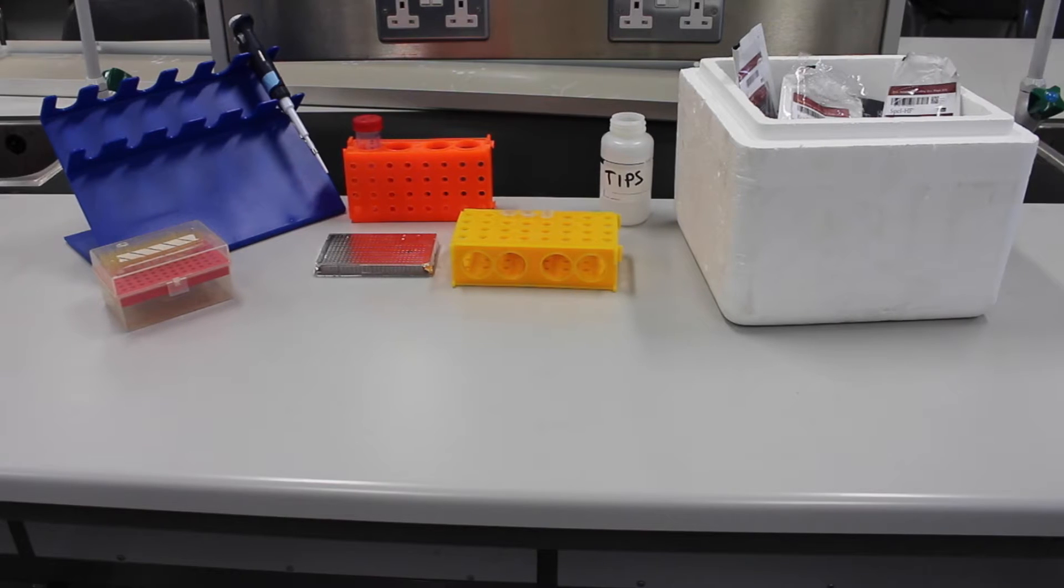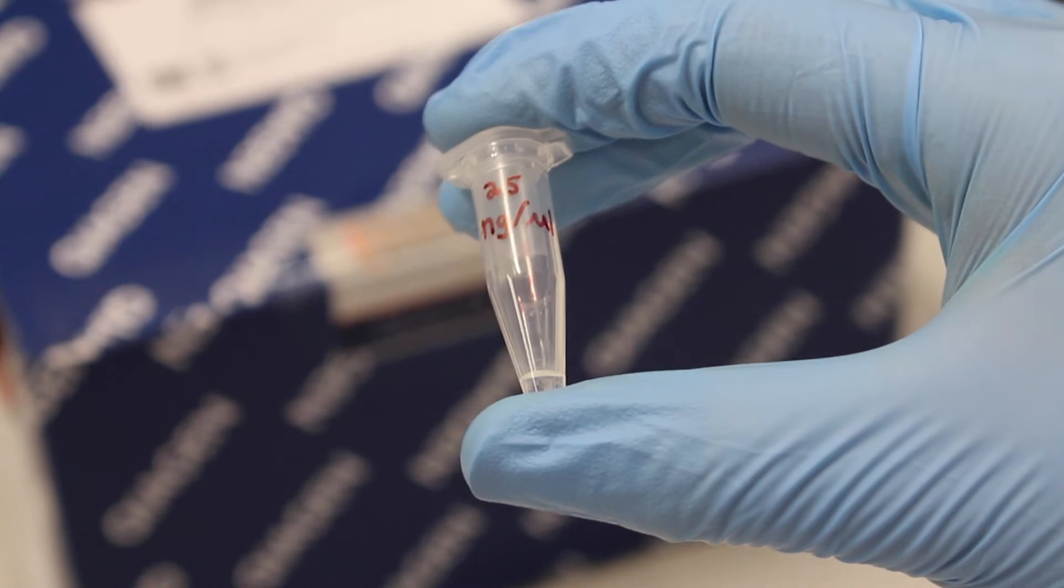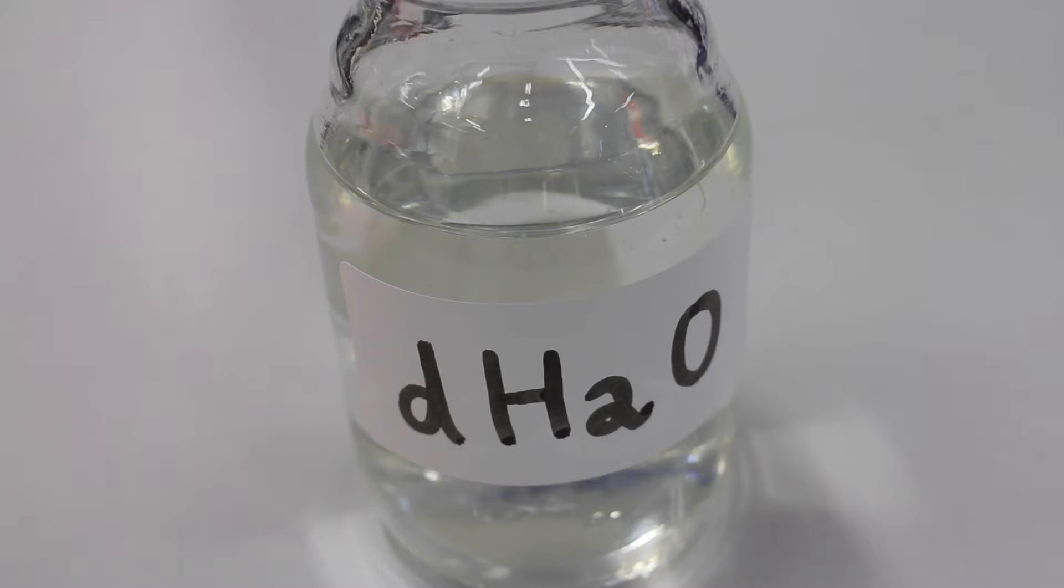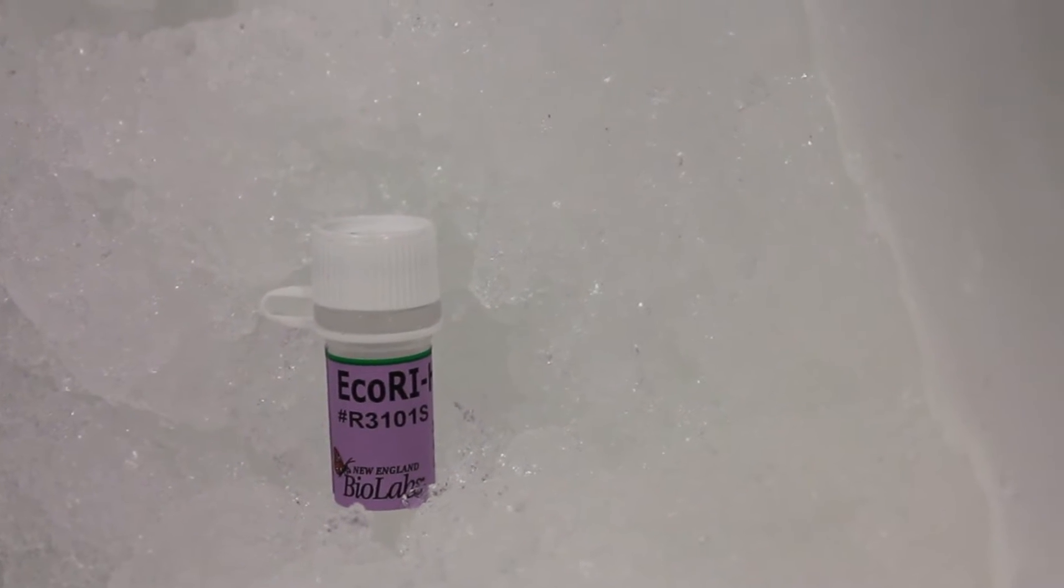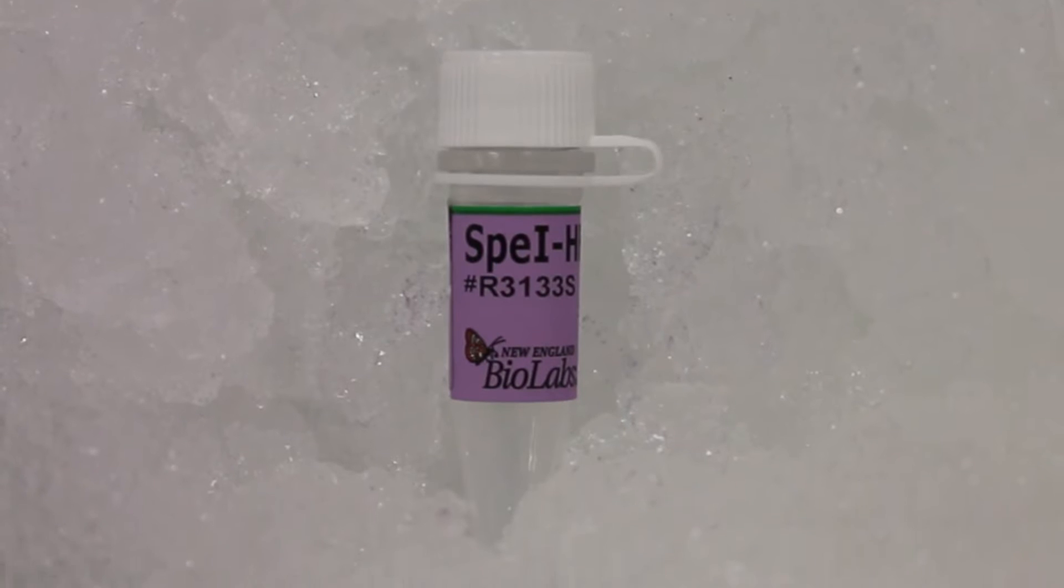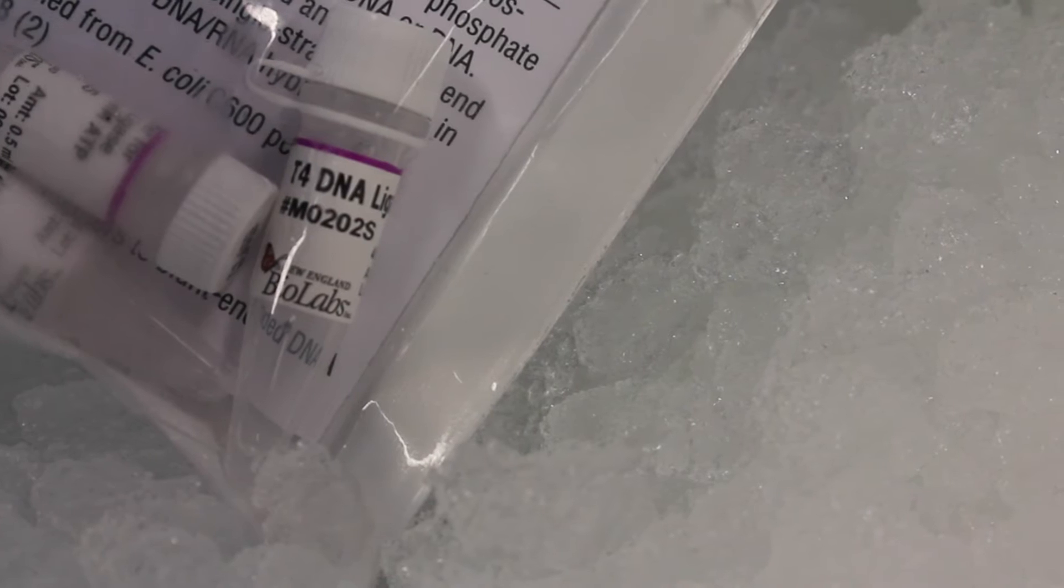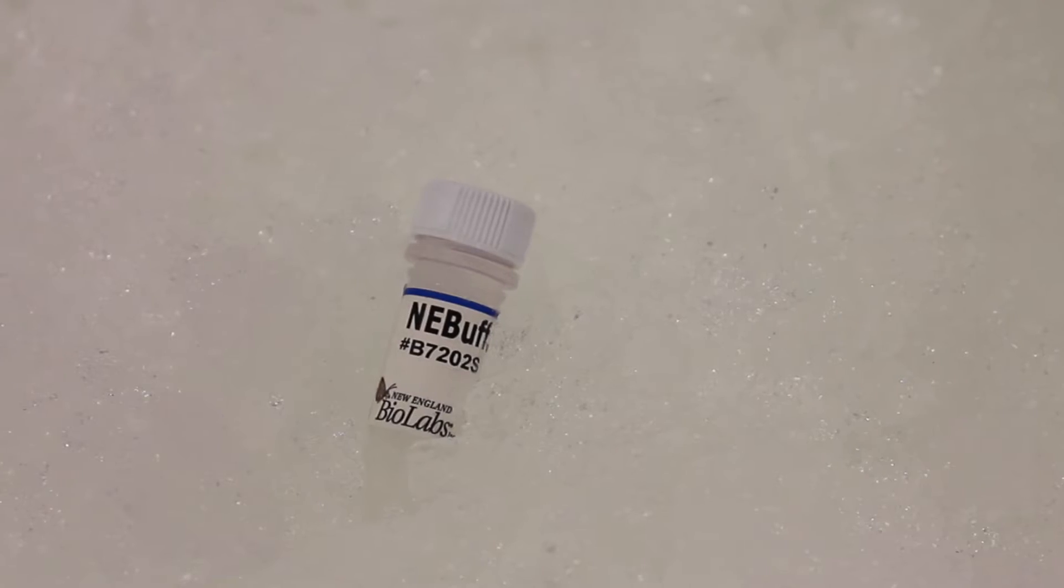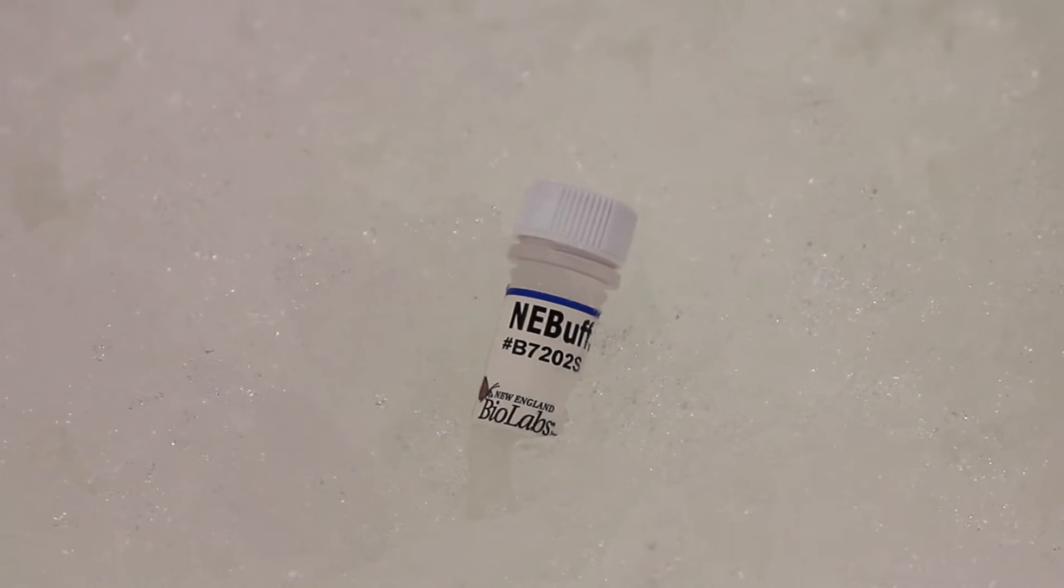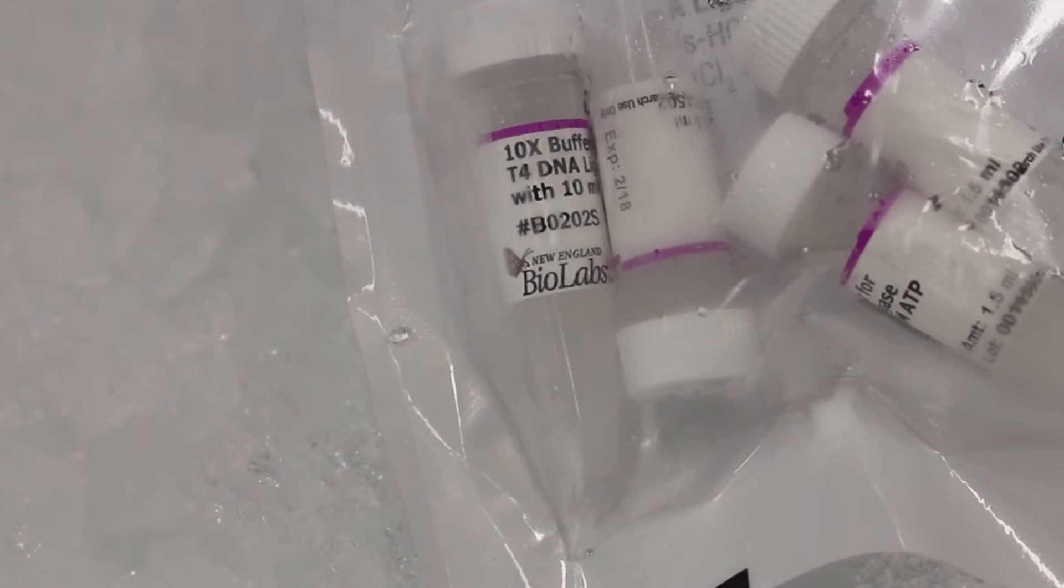For BioBrick 3A assembly, the following are needed: purified DNA plasmids, distilled water, the enzymes EcoR1, XbaI, SpeI, PstI, and T4 DNA ligase. 10X DNA ligase reaction buffer is also required.